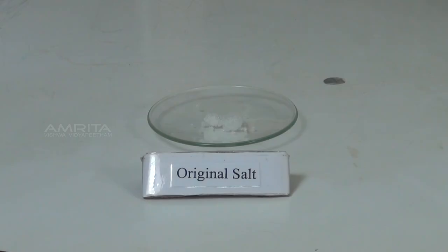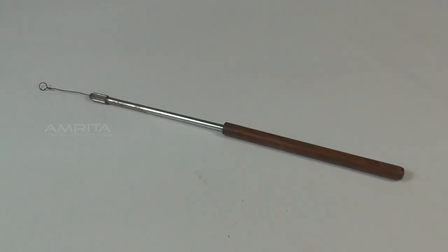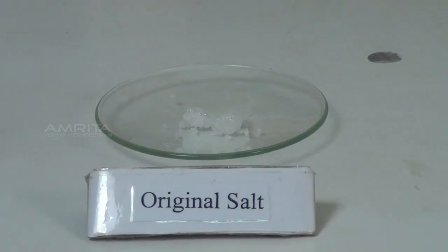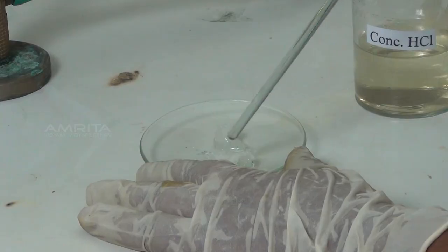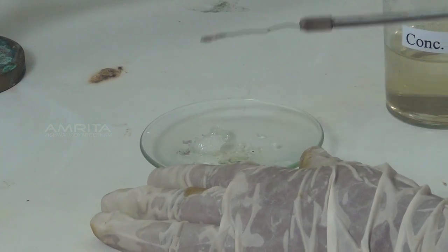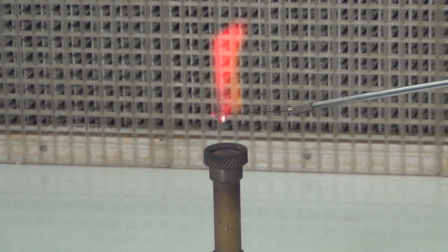Flame Test. Materials required: original salt in a watch glass, concentrated hydrochloric acid, dropper, glass rod, platinum wire loop and Bunsen burner. Procedure: take a small quantity of the salt in a watch glass. Add a few drops of concentrated hydrochloric acid using a dropper. Mix the contents of the watch glass using a glass rod to make a paste. Place a small amount of the paste in the platinum wire loop and introduce it into the oxidizing flame of the Bunsen burner. A crimson red flame indicates the presence of strontium ions.